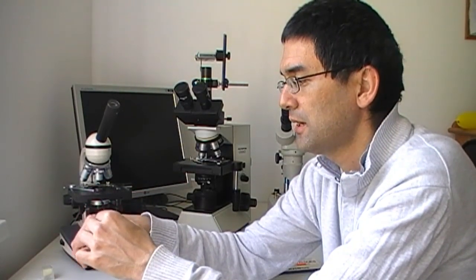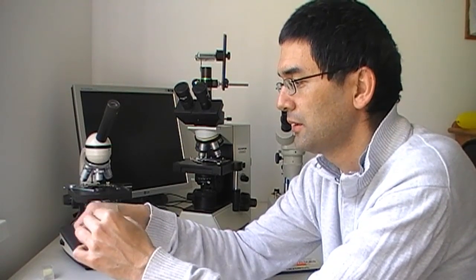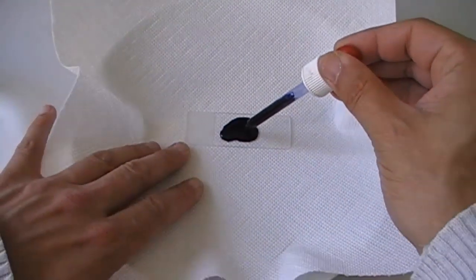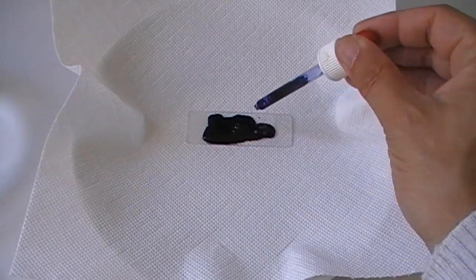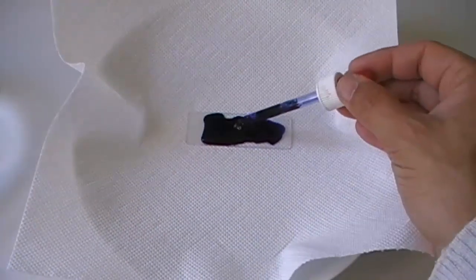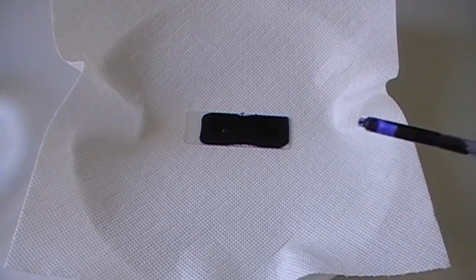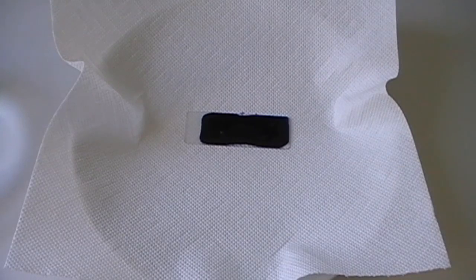It's now cooled down. I'm going to take the soot off a little bit here, and now I can start the staining process using the ink. I've placed the slide on a plate with some tissue paper to protect the table beneath. Now I'm simply going to apply some of the fountain pen ink on the slide and wait a few minutes, spreading it a little bit. The staining process usually does not take very long — usually two or three minutes should be enough. I'll give it some time for the cells to take up the ink.